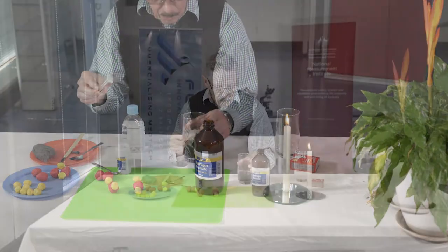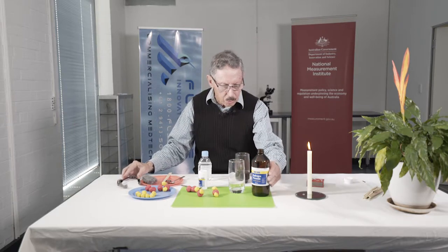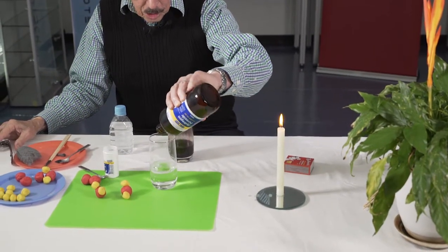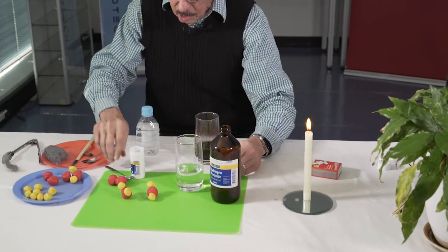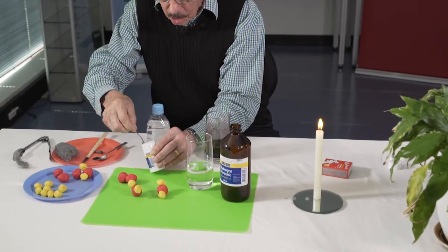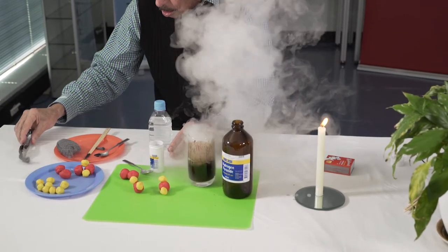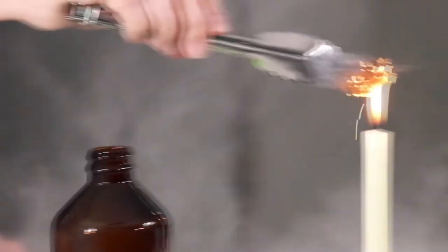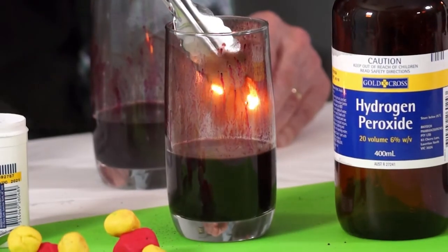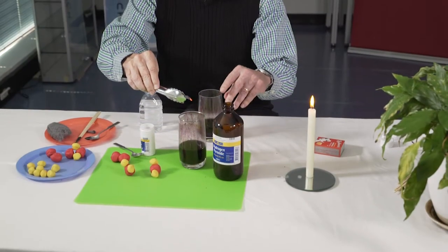To do that, I'll get some more oxygen generated. We need some more hydrogen peroxide in the glass, and some more potassium permanganate. Once it starts giving out oxygen, I'm going to set the steel wool on fire — we'll see it burning in air first, and then burning in oxygen. In goes the potassium permanganate, there's the oxygen. The steel wool burning in oxygen burns even more brightly — in fact, it looks like a sparkler. So that's one way of making oxygen: with potassium permanganate and hydrogen peroxide.